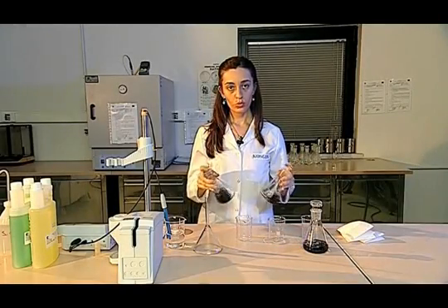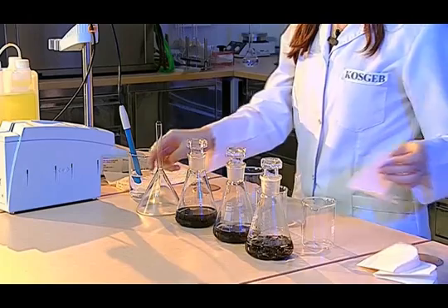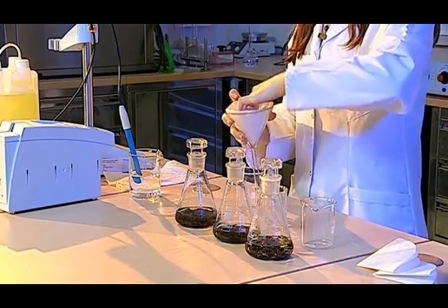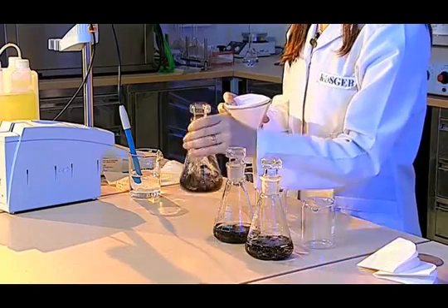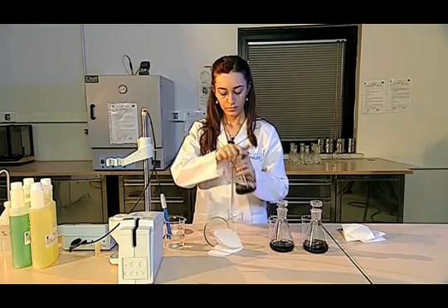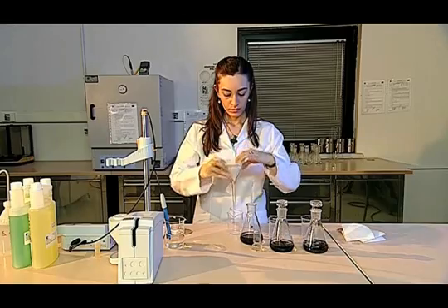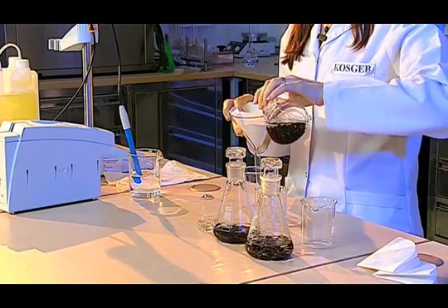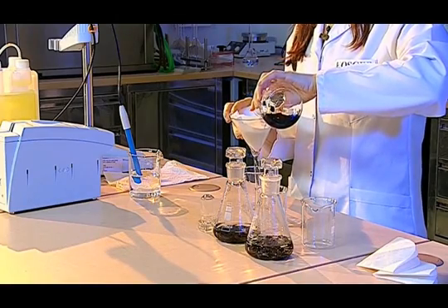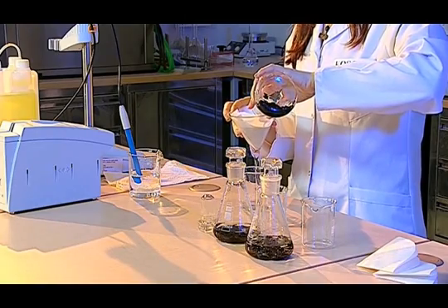We measure the pH values of the samples, which have been taken out of the device. For this, we first apply the filtering process. We put the filter paper that we cut into the cone. We filter our sample. In this process, it is very important not to touch the solution with our hands, because it may affect the pH value.